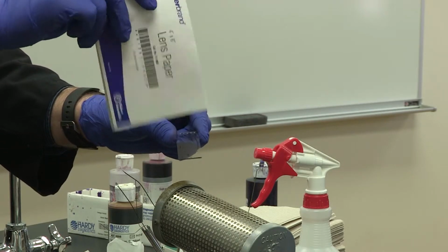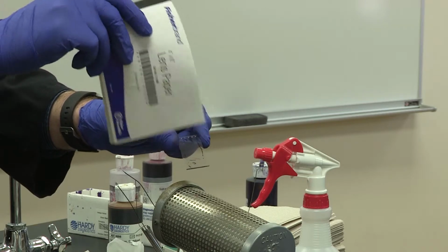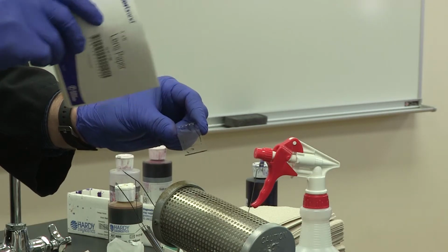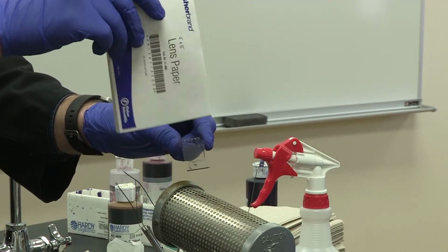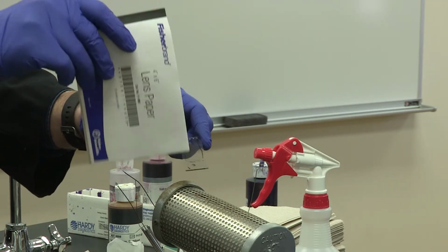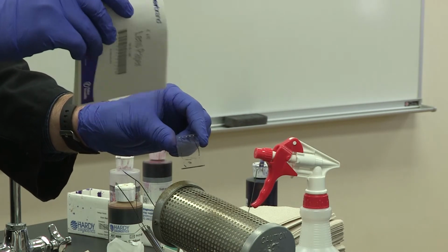and that's going to be rather frustrating. And so once you determine your gram type, this is going to go a long way at determining the species that you have for your identification reports. And so you're going to use the blast search, your gram stains, all of your biochemical tests to identify the bacteria that you have.